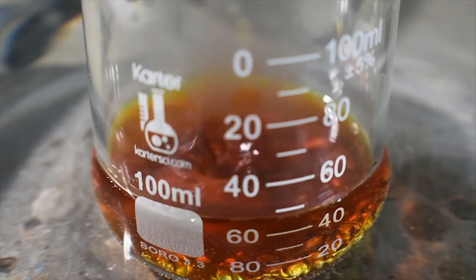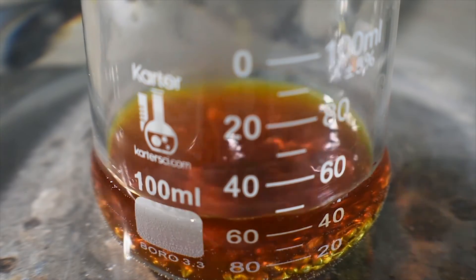Now that is the color that I wanted. Perfect.